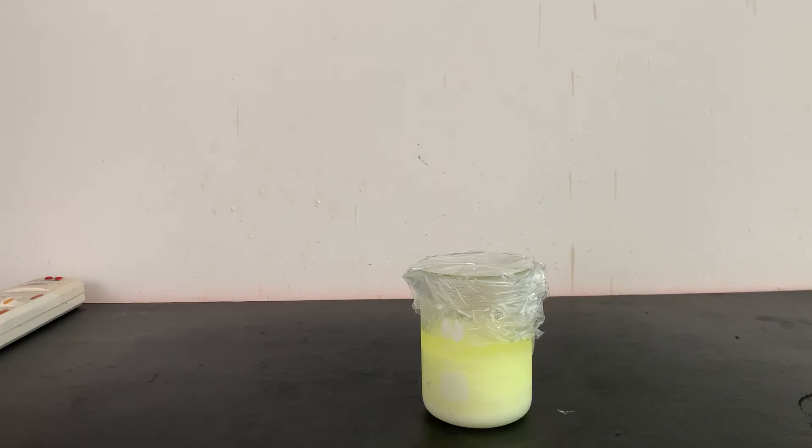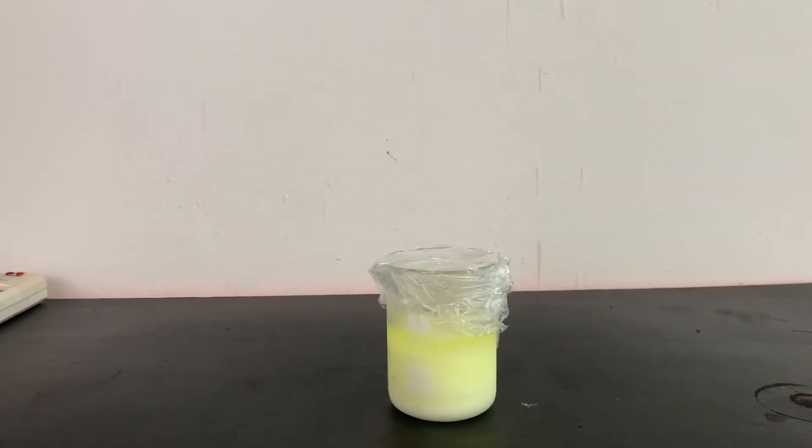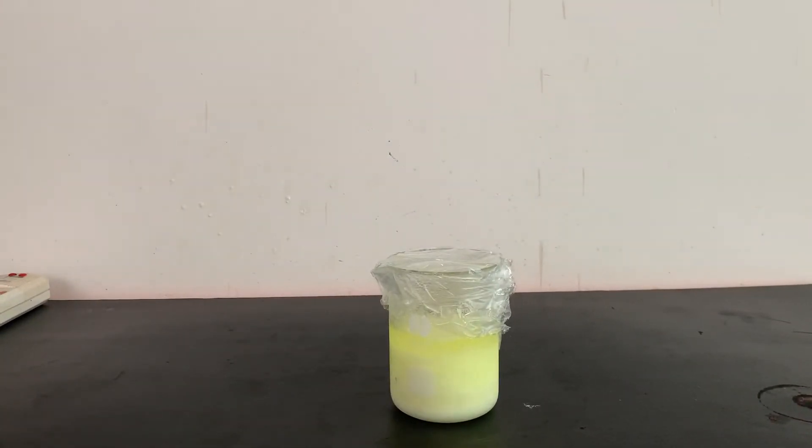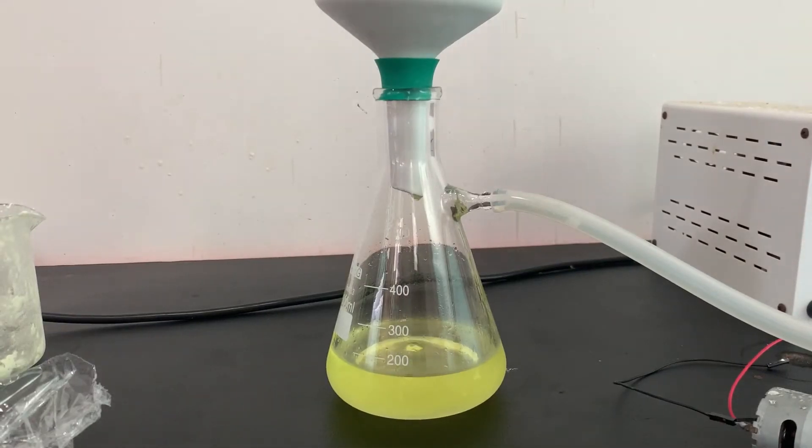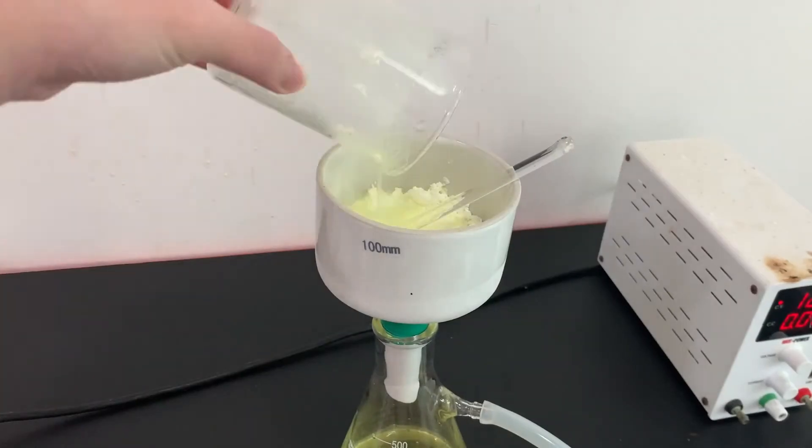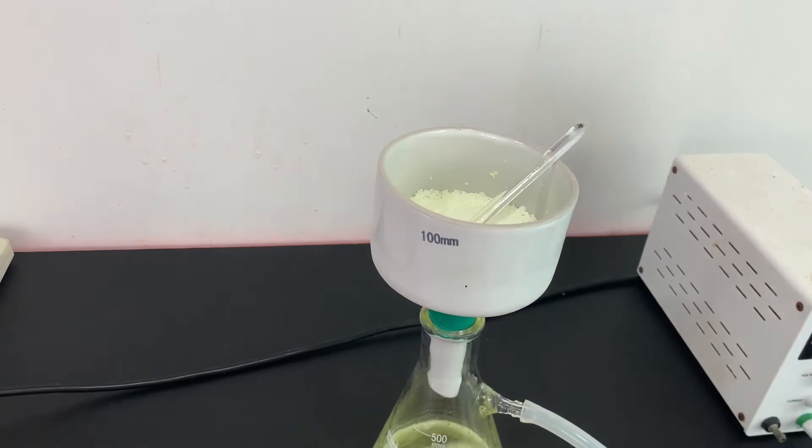After cooling, crystals of 3-nitrophthalic acid will crystallize out while the side products stay in solution. The crystals were separated by vacuum filtration and then washed with some cold water.